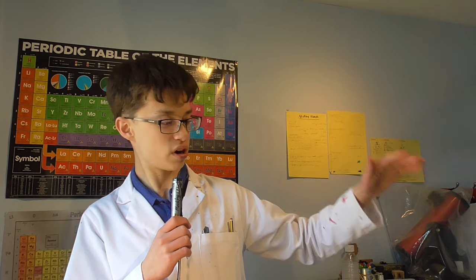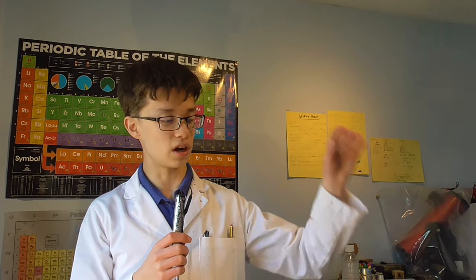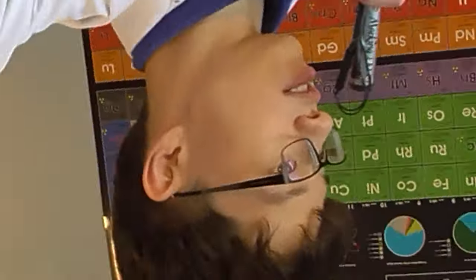So instead of trying to make these copper chloride and copper hydroxide intermediates, I decided to see what would happen if I just did direct electrolysis with copper electrodes of acetic acid — and guess what? It actually worked! So here you see me using a copper anode and a graphite cathode to electrolyze a 40% solution of acetic acid.